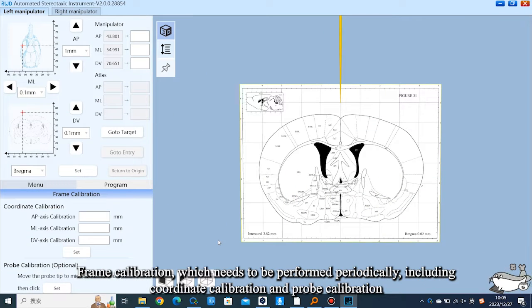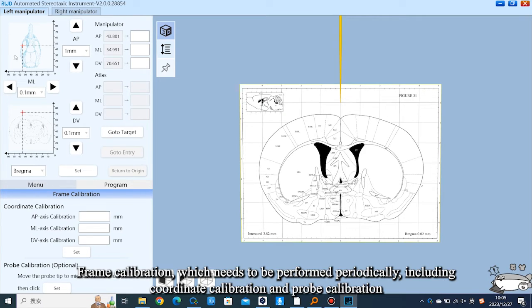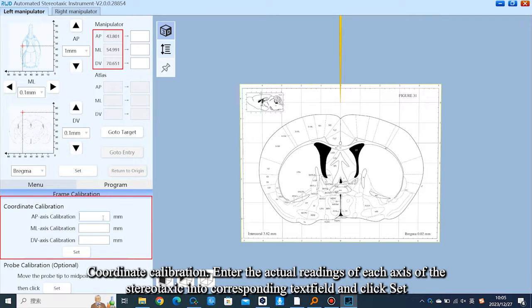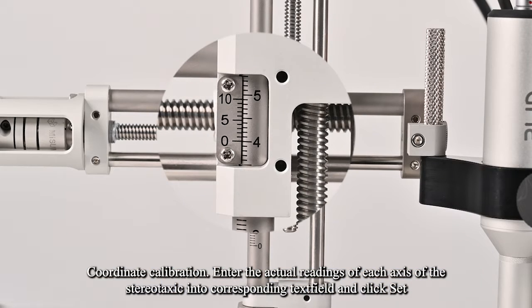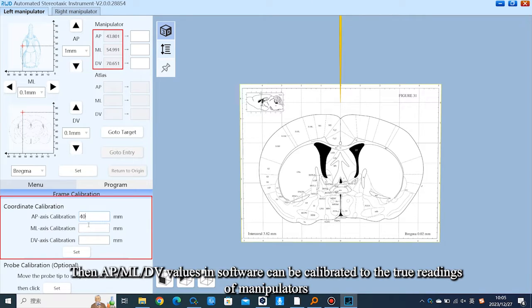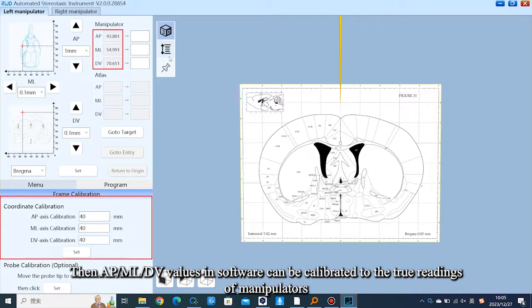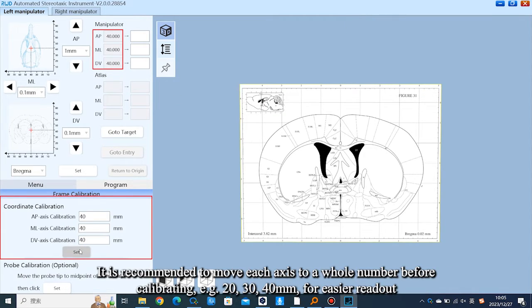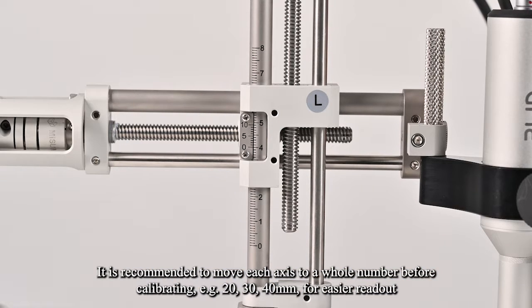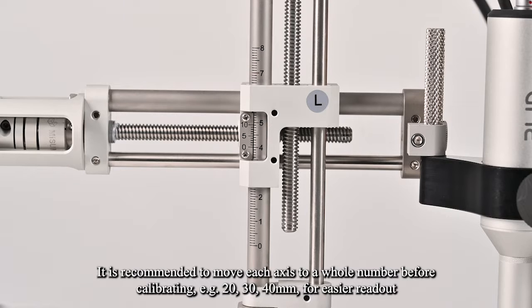Frame calibration needs to be performed periodically, including coordinate calibration and probe calibration. For coordinate calibration, enter the actual readings of each axis of the stereotaxic instrument into the corresponding text field and click Set. This calibrates the AP, ML, and DV values in the software to the true readings of the manipulators. It is recommended to move each axis to a whole number before calibrating — for example, 20, 30, or 40 mm — for easier readout.